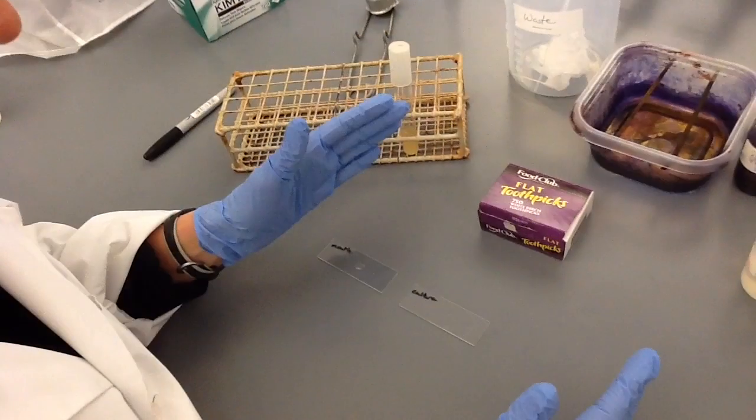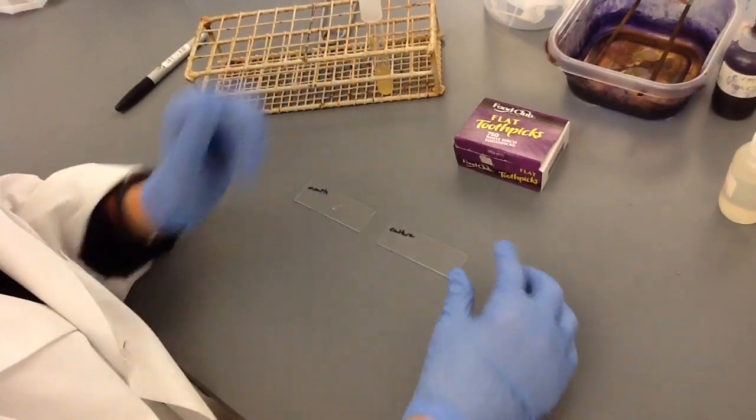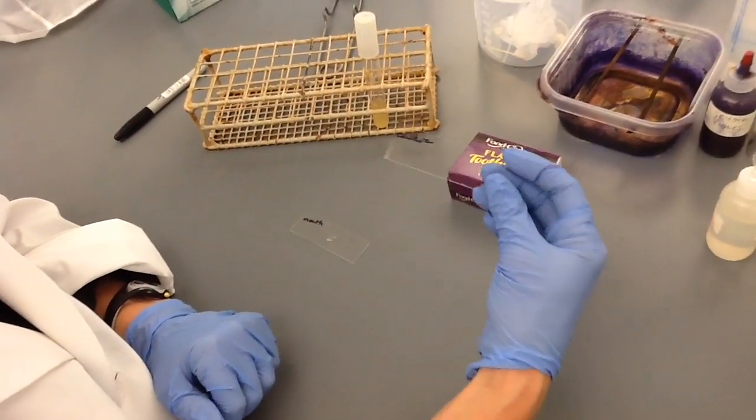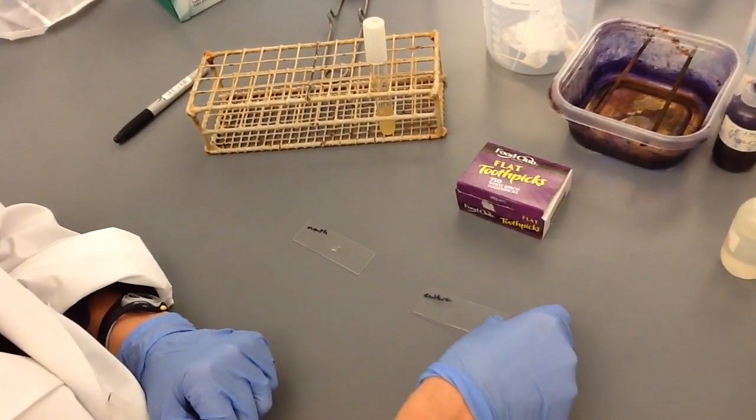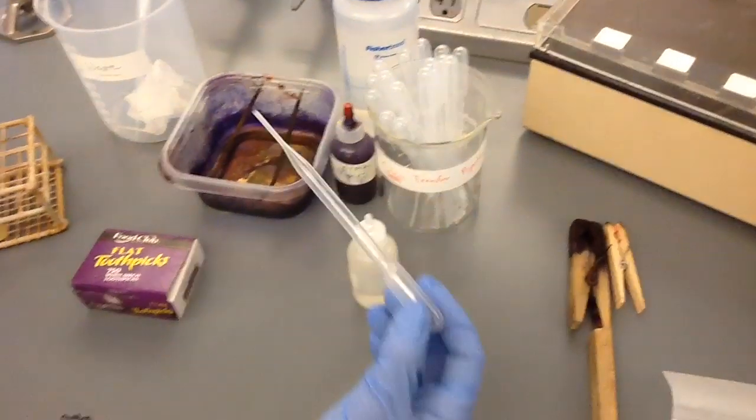I'm going to put gloves on because I'm handling a live bacterial culture. I'm going to take the other slide which I've labeled culture.